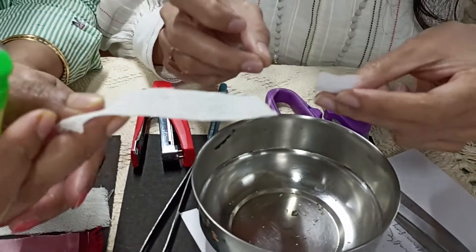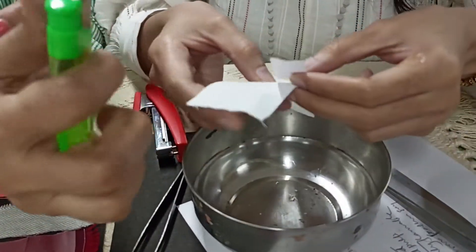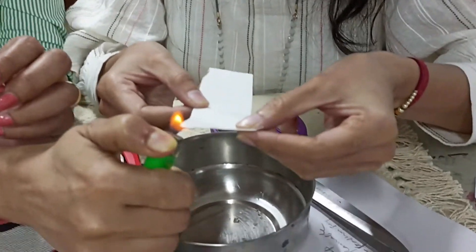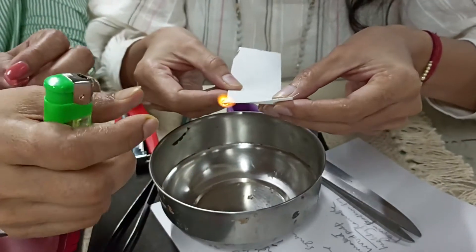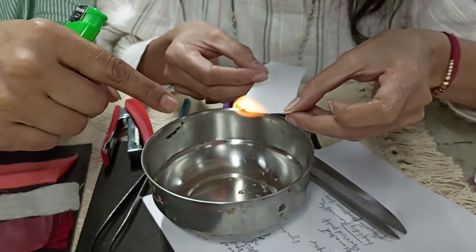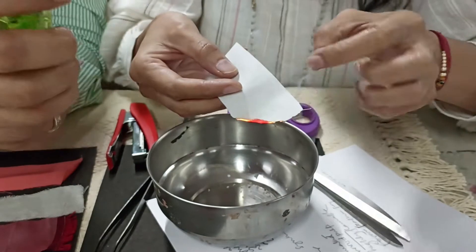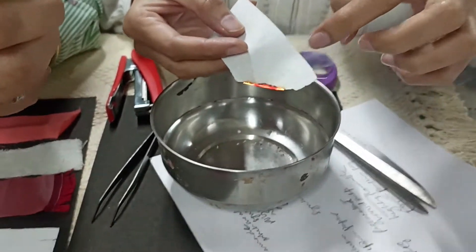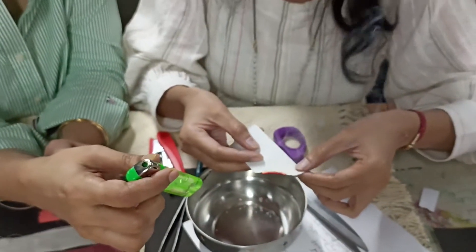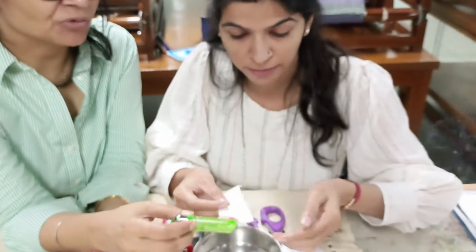We burnt paper to show that it is similar to how cotton and all plant-based cellulosic fibres would burn. Now we are burning a cotton sheeting fabric. It carries flame and is not self-extinguishing — you have to extinguish the fire. When you extinguish it, there is an orange afterglow. The smell of the smoke is similar to that of a burning paper, and it has white smoke coming out.